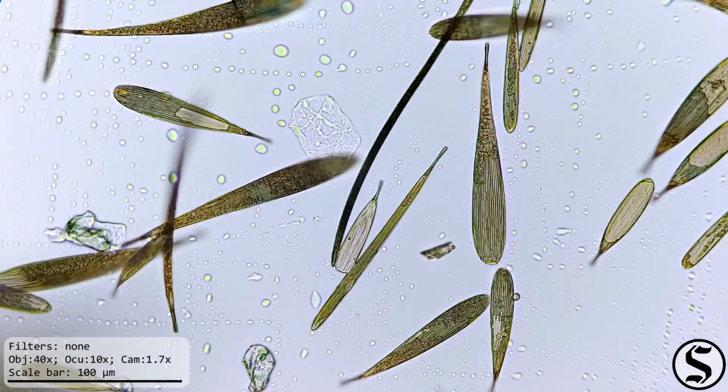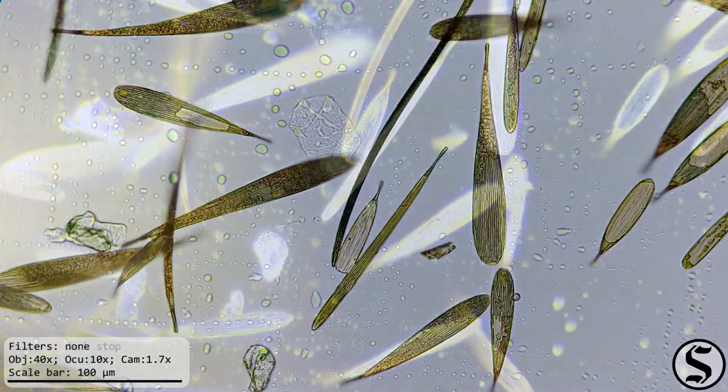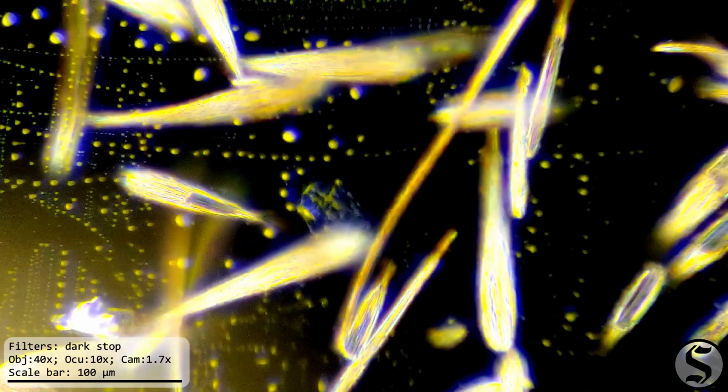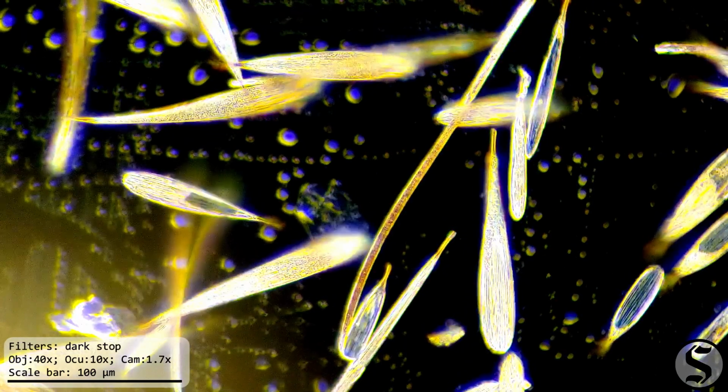Well, hey, that was a neat little look at this drain fly. Certainly had a lot more fuzz and a lot more going on with it than I expected. And that's why we gotta check stuff out.